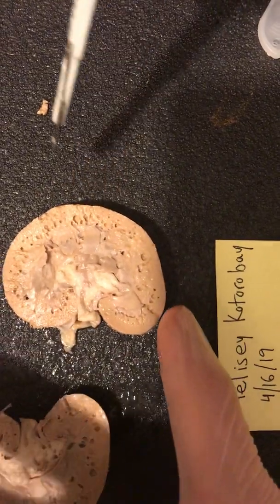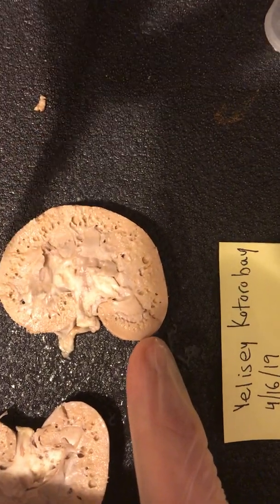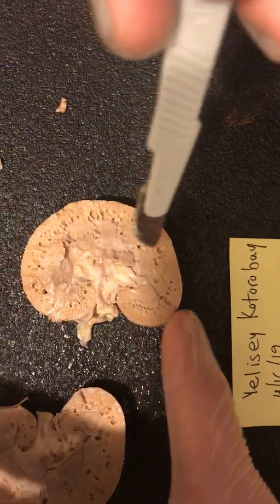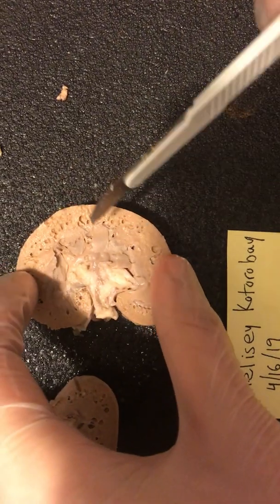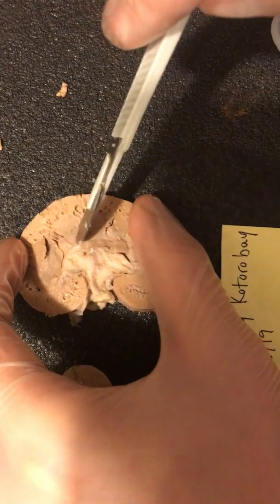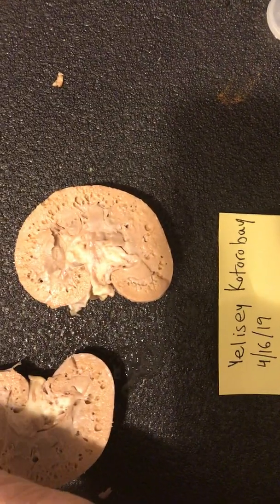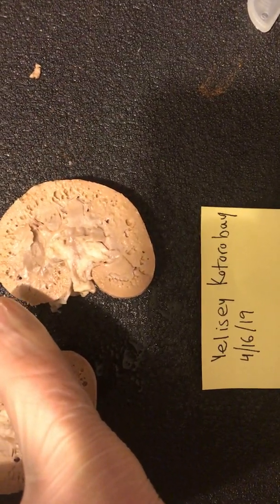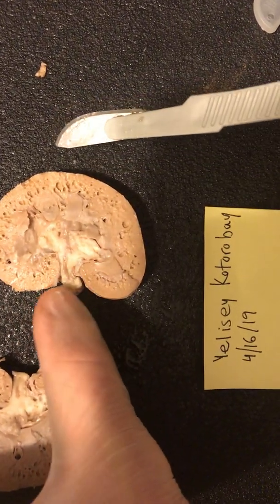Much like your cerebral cortex encapsulates everything else in your brain, this encapsulates the rest of the stuff in the kidney. You can't really see it too well, but there's a bunch of little pyramid-shaped triangles. There's a pretty good cross-section of one right here. That's what we, in the industry, call the renal medulla, at the very top of which are the glomeruli, and those drain the blood of all the filtrates that we need to cycle out.